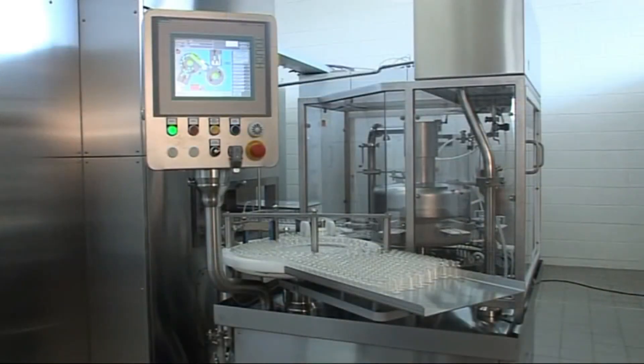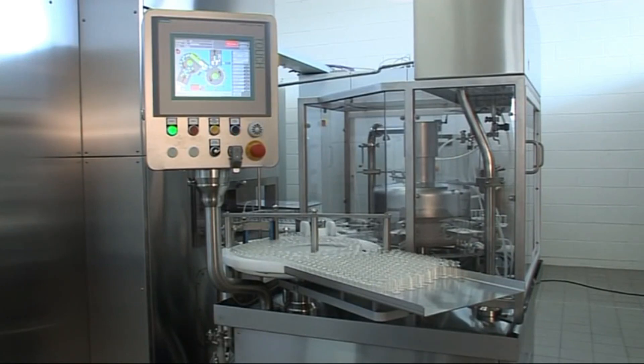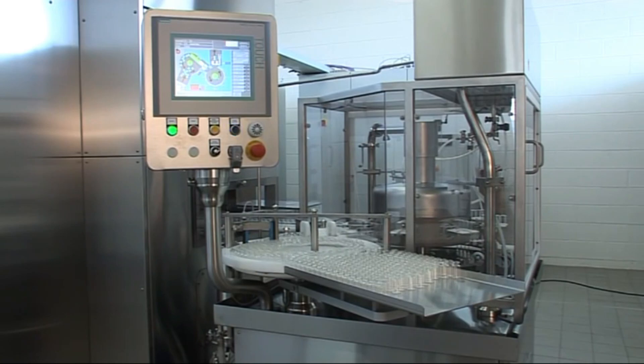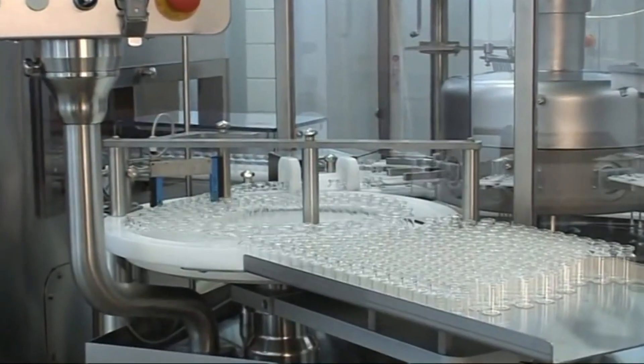The air inside RABS is often HEPA-filtered, providing a grade A environment, with the surrounding area usually being grade B. RABS is often integrated into a clean room, allowing for direct interaction with minimal intervention.